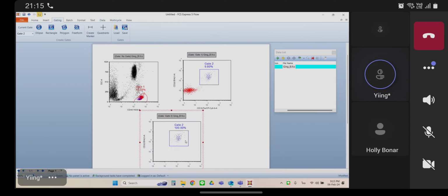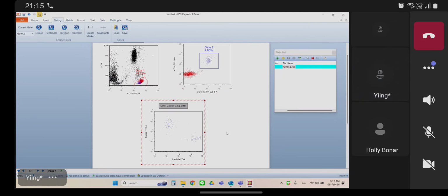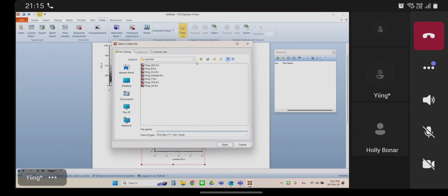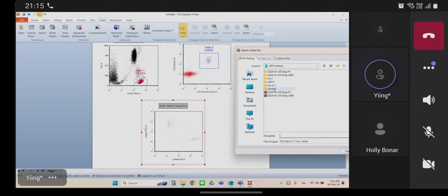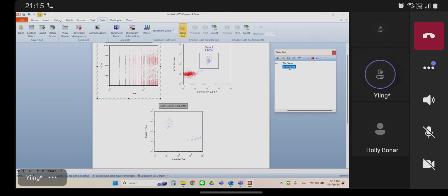Okay, I will show you 3 parameters. When I create the template and finish, then when I analyze the patient data, I will insert some patients into the template. Okay. Why can the data not be removed? Yeah.